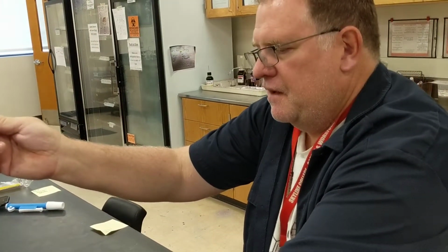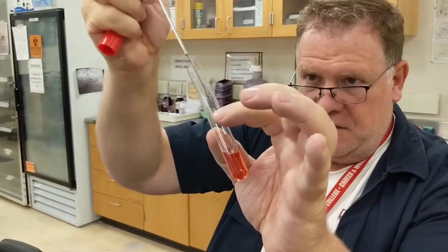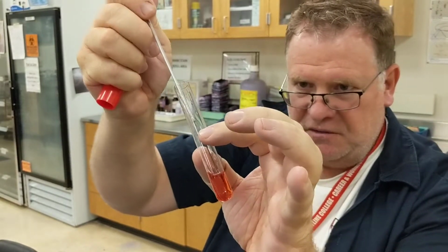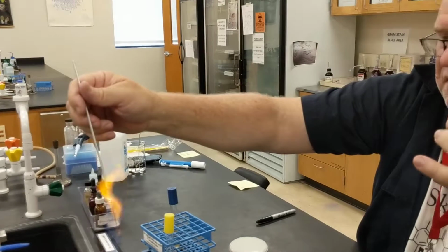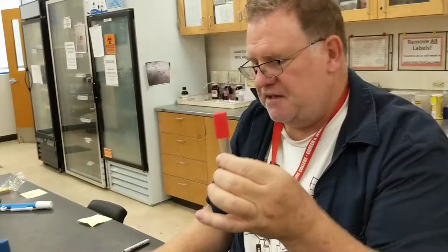And then we would take our culture. You hear a little bit of sizzling. I don't usually like to hear that sizzling on there. Then I'm going to go into our new Durham tube. You can swish it around a little bit like this, moving it back and forth a little bit. I did my inoculation of the tube. Sterilize my loop. And that's basically the technique for the carbohydrate, the phenol red.